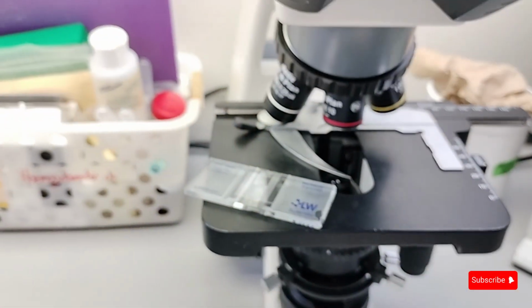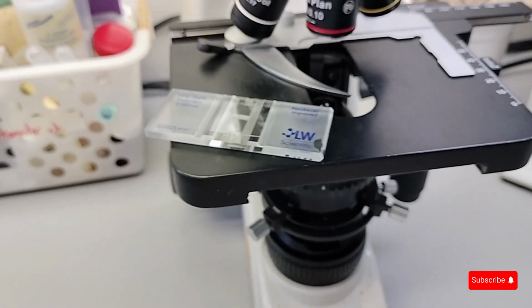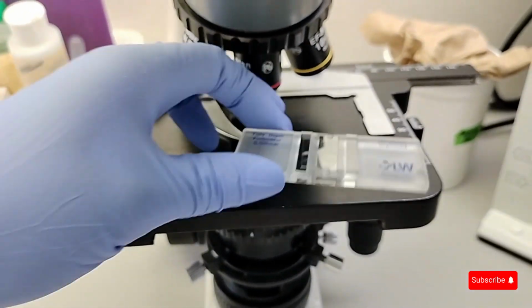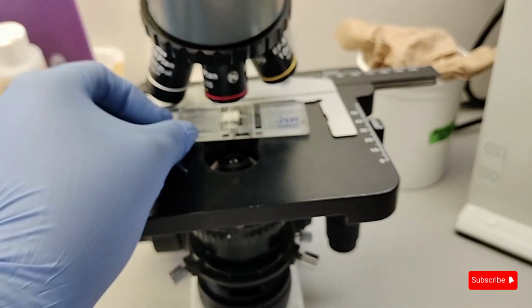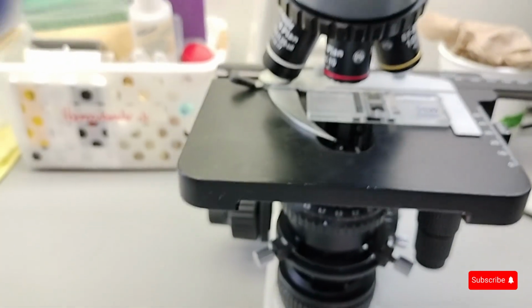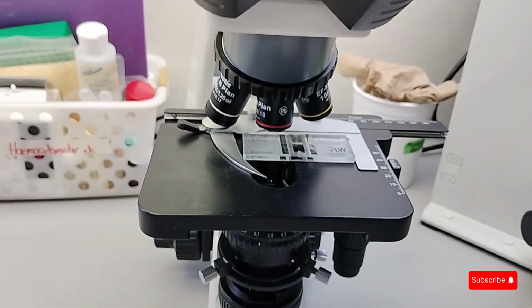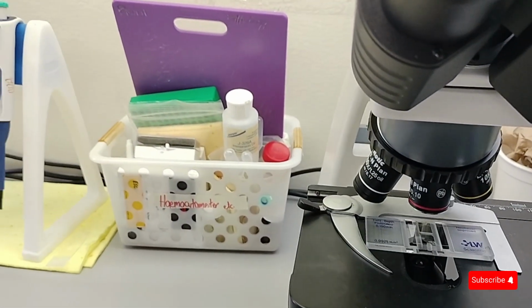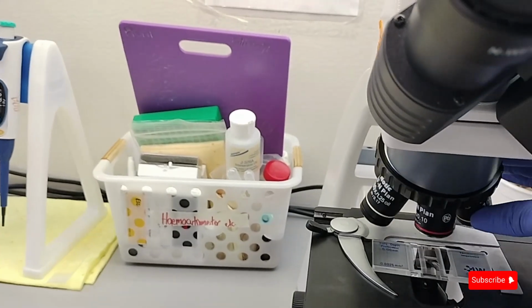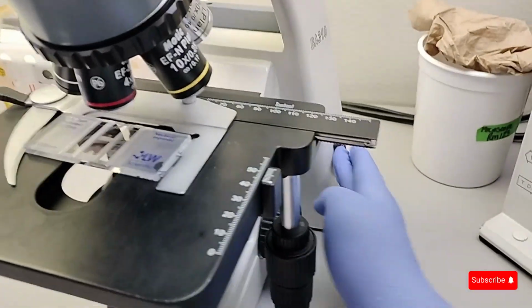What I'm going to do is, before I inoculate the plate with the fungus, I'm just going to run a quality control check on the spores that were in the little white tube, to ensure that what I'm going to put on the plates are what I want. So I'm going to turn the light on. It's there.